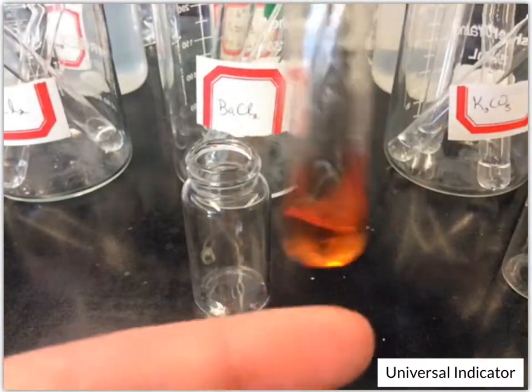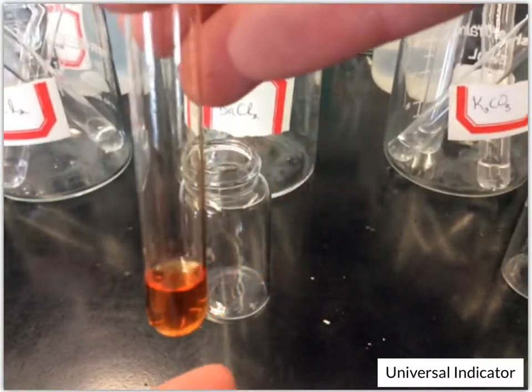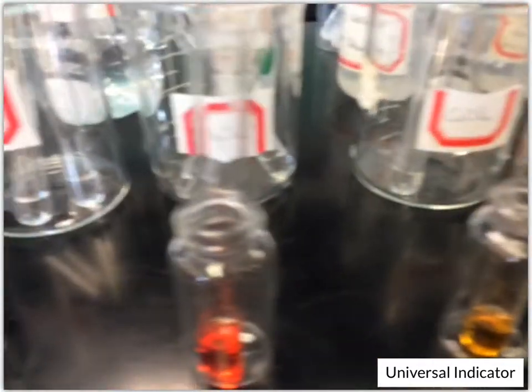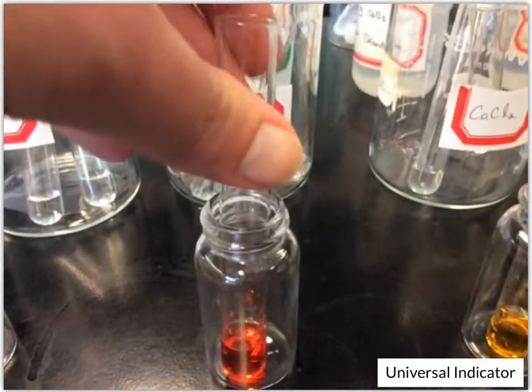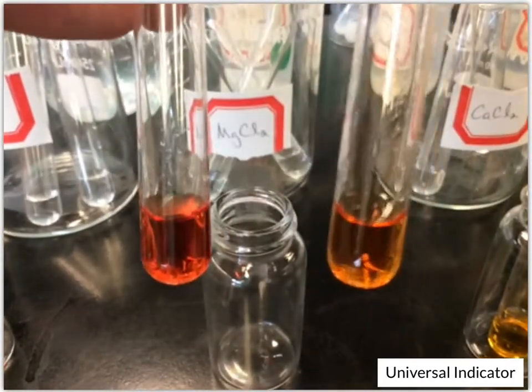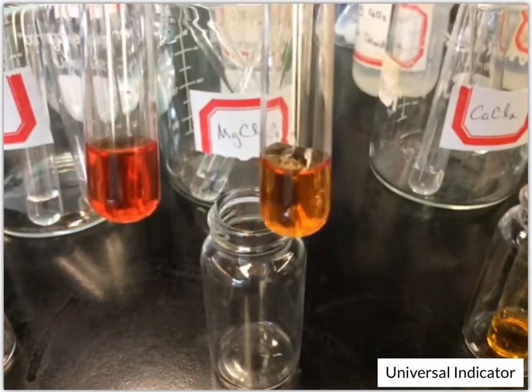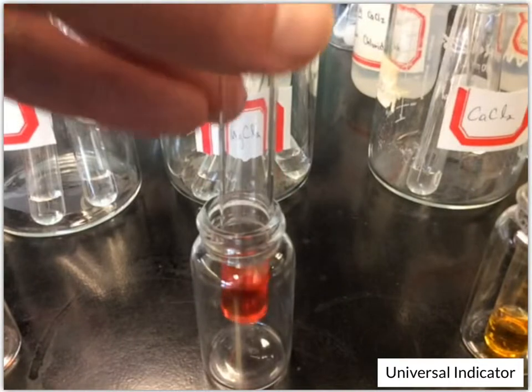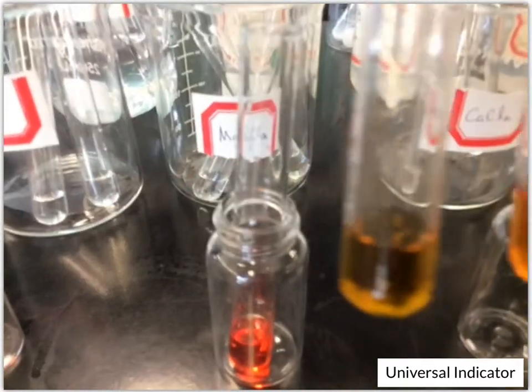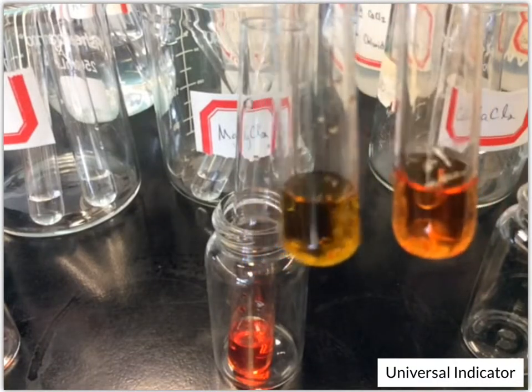Okay, this one's also starting out light compared to the others. But now if we go back and compare, we've got the magnesium chloride, and it's this dark color compared to this lighter one of the barium chloride, right? And so it's lighter than the magnesium chloride, but then between the calcium chloride and the barium, the calcium's lighter than the barium.